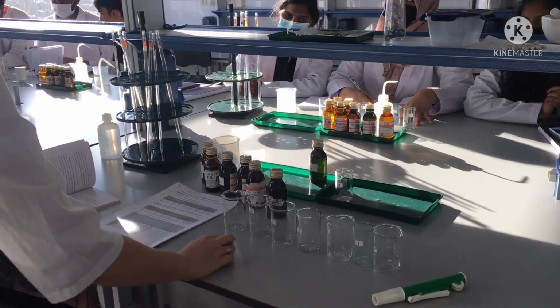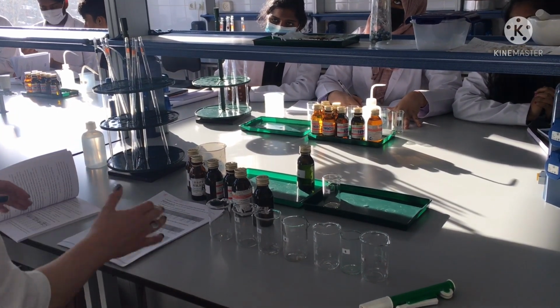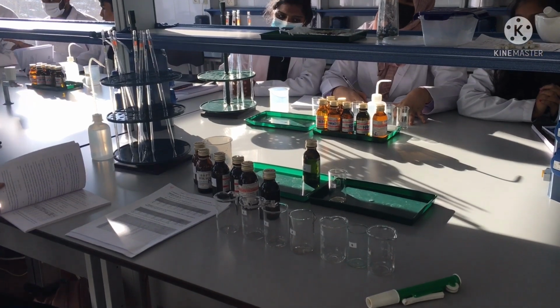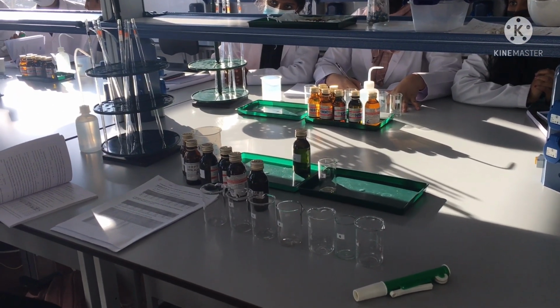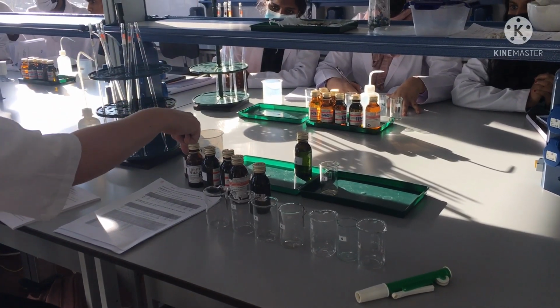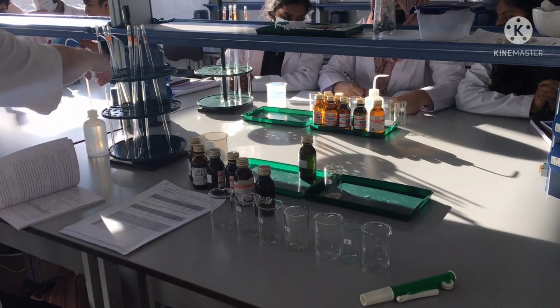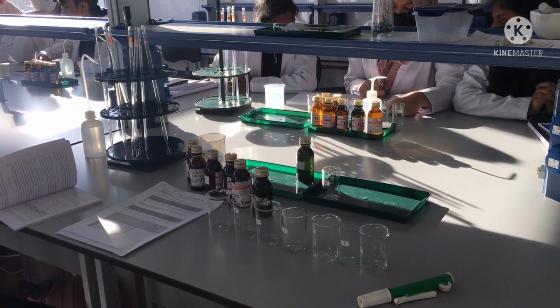And after you prepare all mixtures, you need to prepare the timer and be ready to start and stop the time. You will add the final reagent, and when the last drop leaves the pipette, you will start the timer.